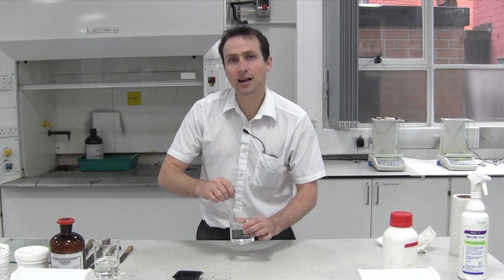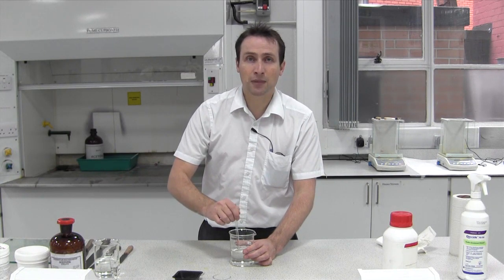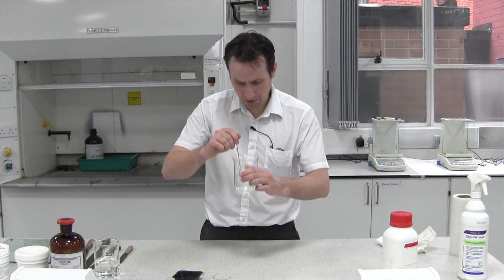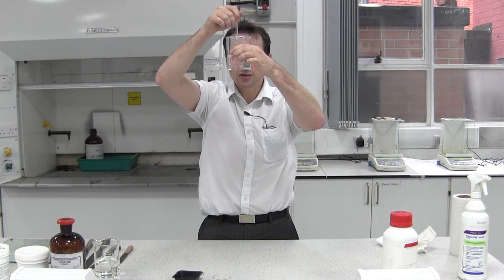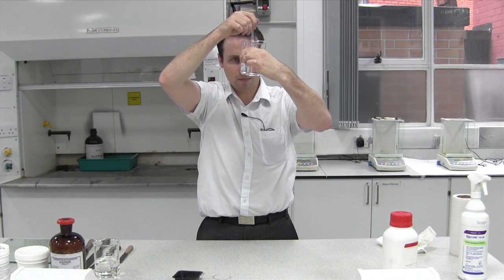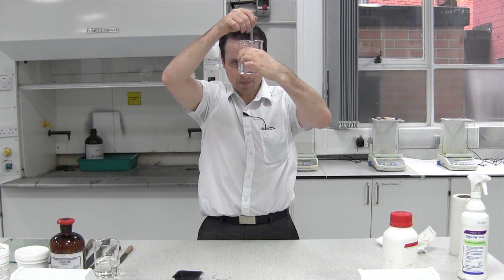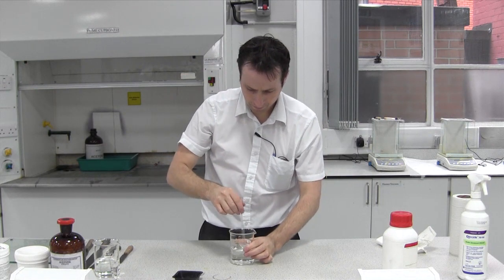Now some of the larger granules, or larger particle sizes of whatever powder you're using, may take longer. So just make sure it's all incorporated. There are still a few little bits and pieces at the bottom — just gently stir. And that's now in solution.